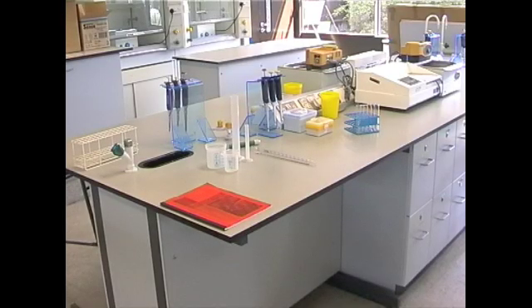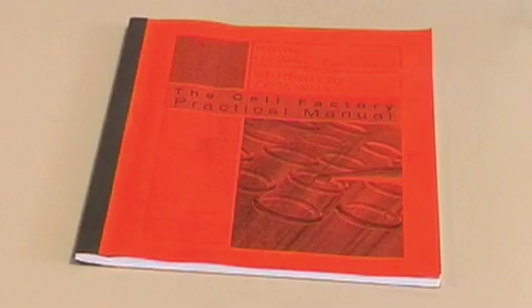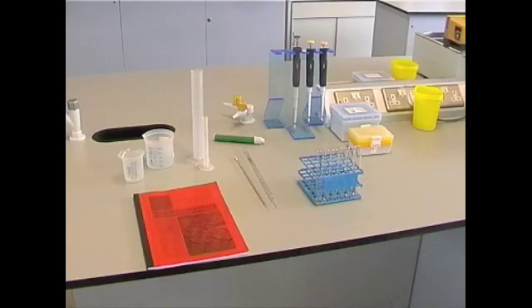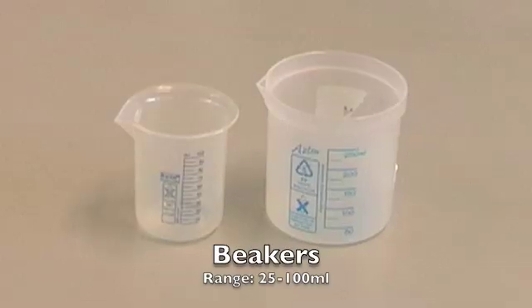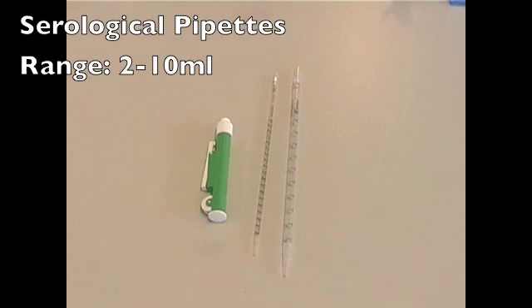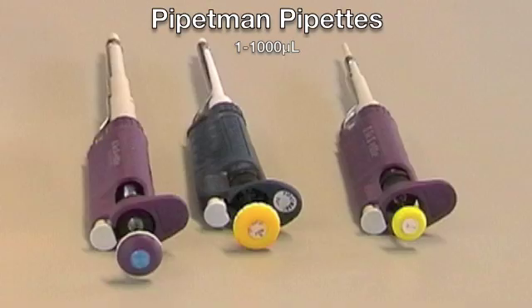When dealing with liquids, it is essential to know the range of devices available and in what situation they should be used. Familiarity with liquid handling devices is essential for any experiment involving liquids. The lab manual is the most important piece of equipment and should never be forgotten. Here you can see the range of liquid handling devices available. Devices such as beakers, graduated cylinders, serological pipettes, and pipetman pipettes.